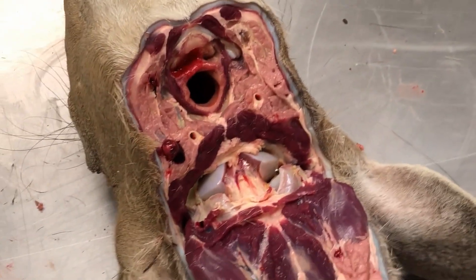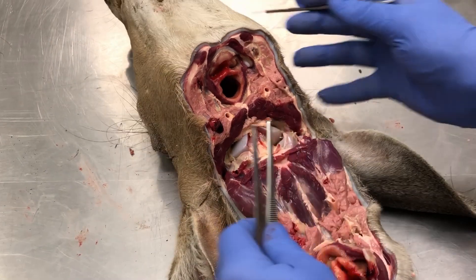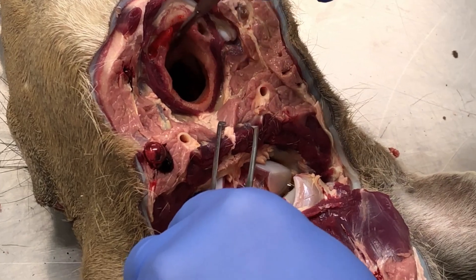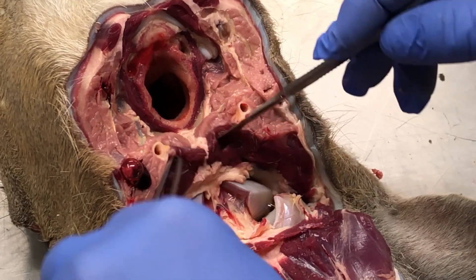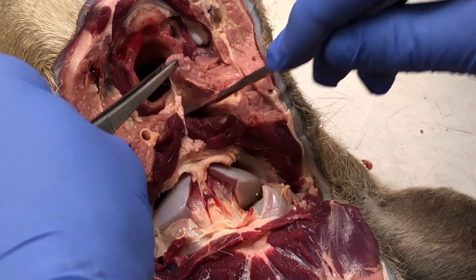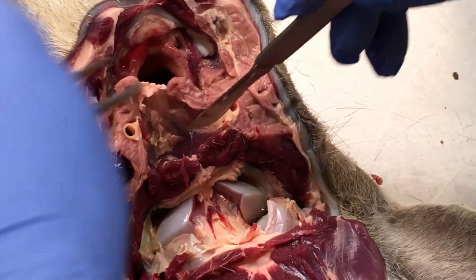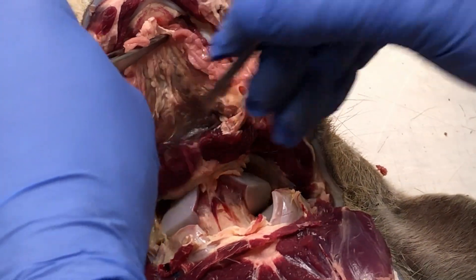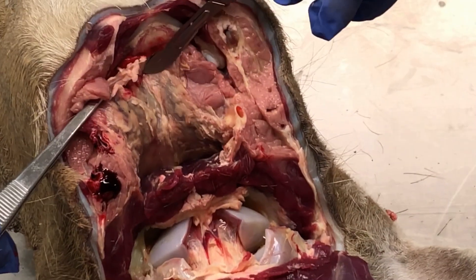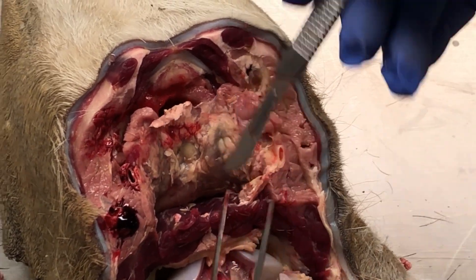So I'm going to move over now to my scalpel and my tweezers. I like to tell people to use your tweezers because I don't want you cutting your fingers off. What to look for on these animals — here you have your opening for your nose area. See these muscles right here? That's a key to look for. What I want you to do is pull down on these muscles and separate the tissue above these muscles from the tissue above it. And as you do this, you'll create this cavity down here. When you get into this cavity, you can already see we have a node on this side and we have a node on this side. That's how simple it is.